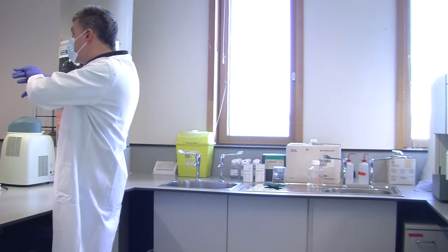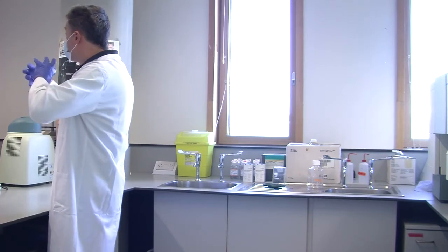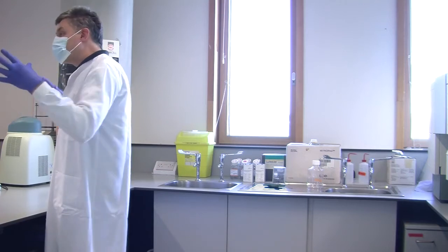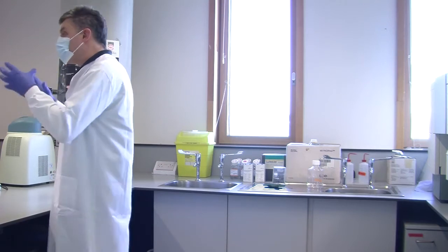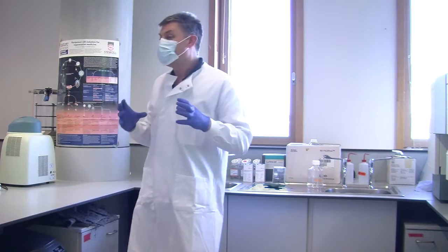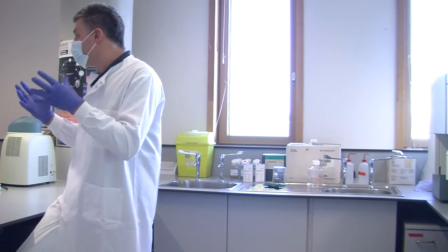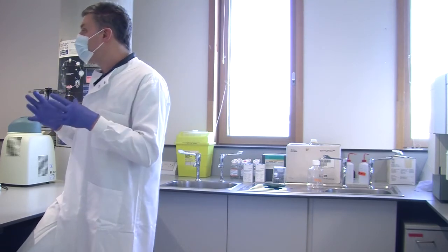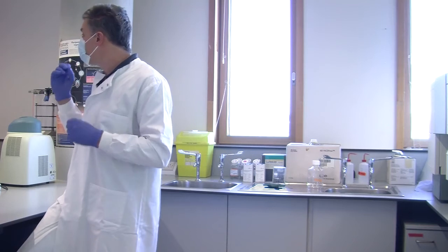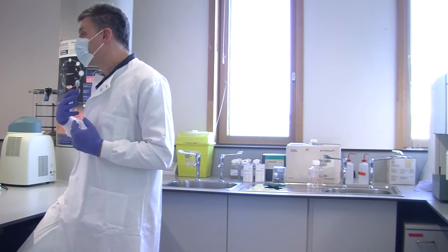The fixative actually ends up getting into the cell, so it cross-links the whole cell, makes all the proteins rigid, and then the saponin dissolves away little chunks of membrane. These are big pores on the cell surface that will allow the antibody in, but the cell is solid, effectively. I once ran some demo cells on an instrument that takes images of the cells. The demo sample was 10 years old. The cells had been fixed 10 years previously, and they looked as good as the day they were first produced. So in theory, with fixing, you can leave cells quite some time.